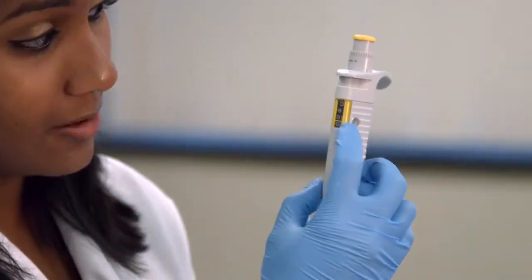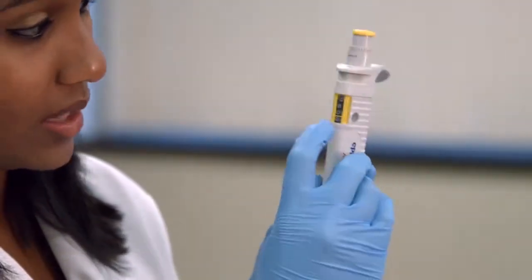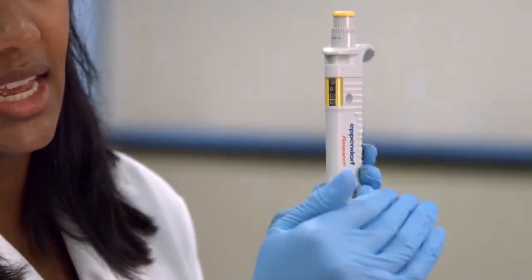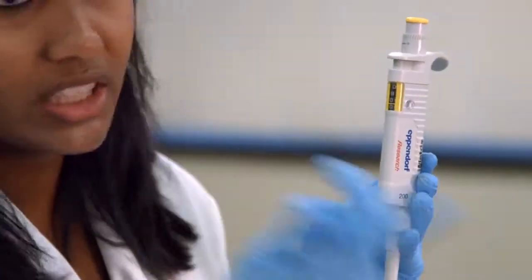So this may look like 800, but in fact, it's actually 80.0, and that line right there in the middle is indicating the decimal point.